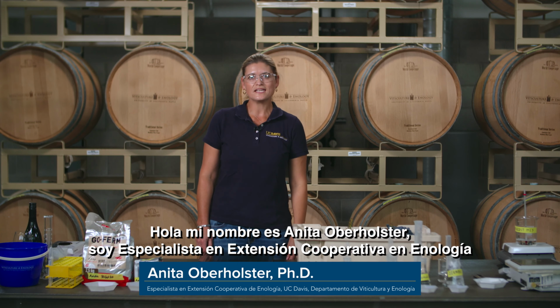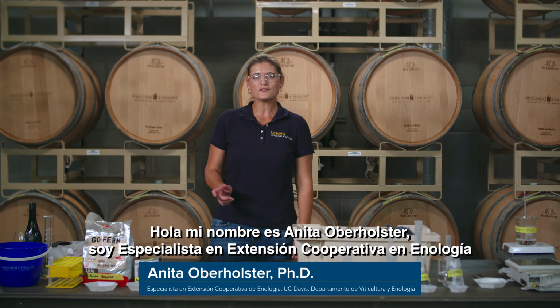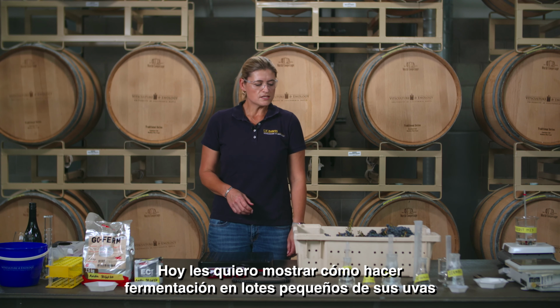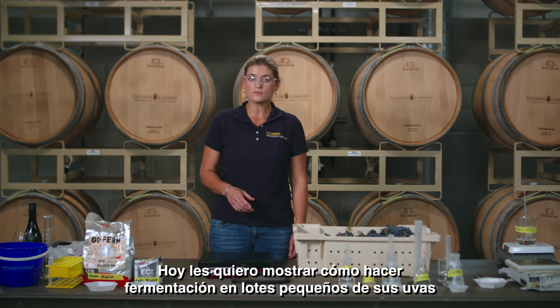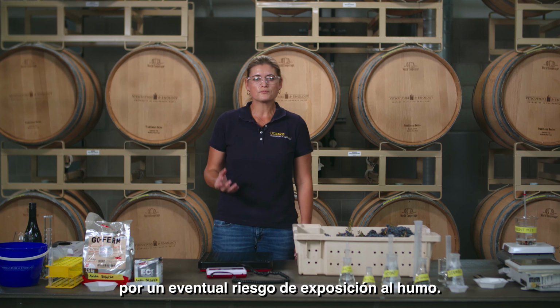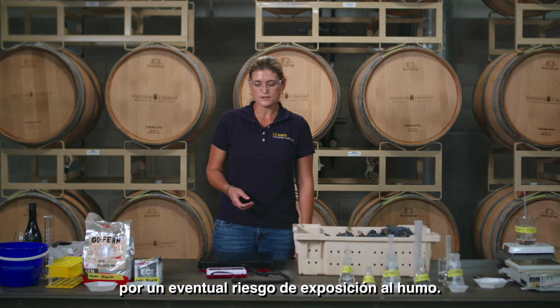Hi, my name is Anita Oberholster. I'm a cooperative extension specialist in enology based at the Department of Viticulture and Enology at the University of California, Davis. Today I want to show you how to do small lot fermentations from your grapes so that you can get a better indication of potential smoke exposure risk.